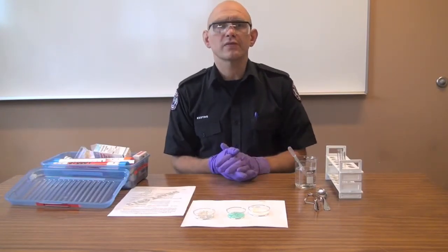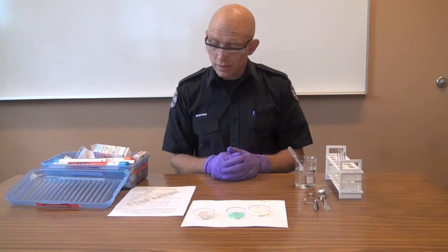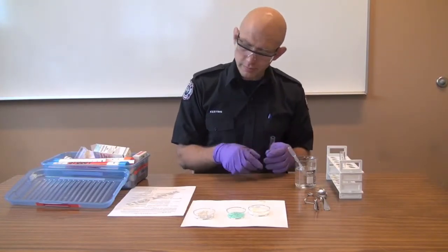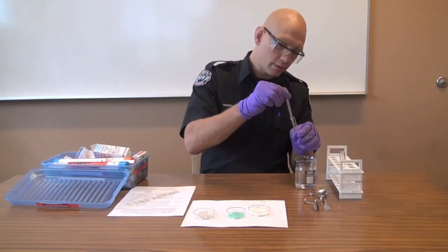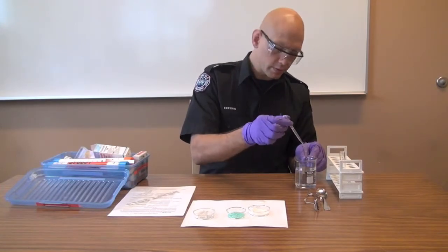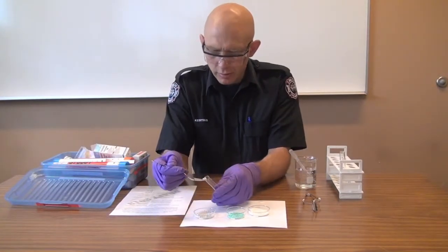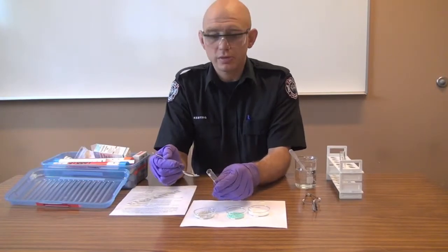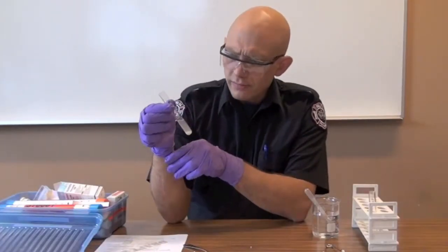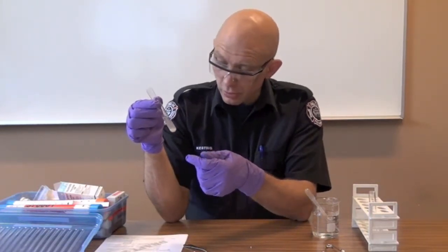What's the third thing? Maybe this stuff is water reactive. Maybe it bubbles when you add it to water, maybe it releases a gas — that could be a flammable gas. Maybe it heats up or cools down. This is another thing we're going to check. I'm going to take a little test tube, add some water — just one or two inches — and add about a pea-sized amount of the compound to it. I'm pointing this away from myself — point it away from yourself, point it at a friend — because if it is water reactive, this could shoot out. I'll look at it for a minute; it could be a slow reaction or a fast reaction. Is it becoming a gel? Is it becoming cold or hot?